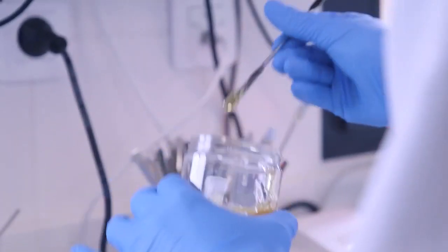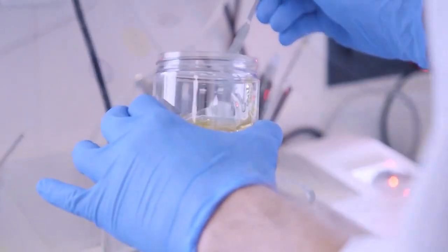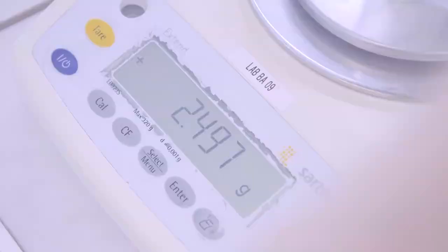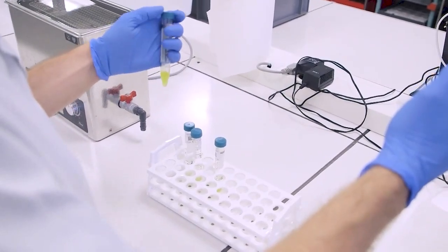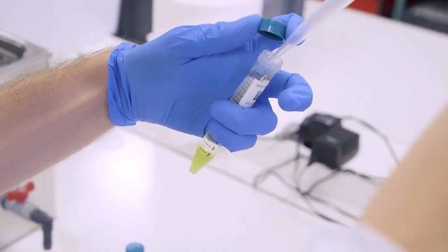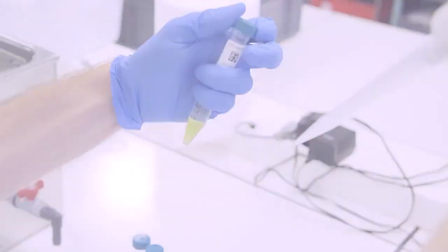A small amount of each honey sample to be analyzed is then weighed out into centrifuge tubes. The samples are diluted with water, mixed, and centrifuged to prepare them for NMR analysis.